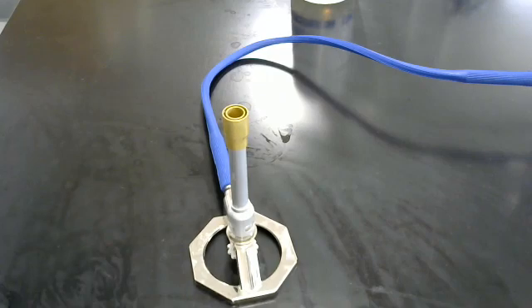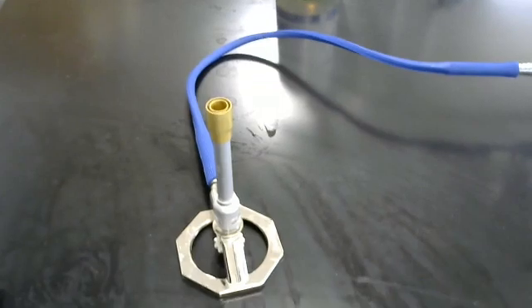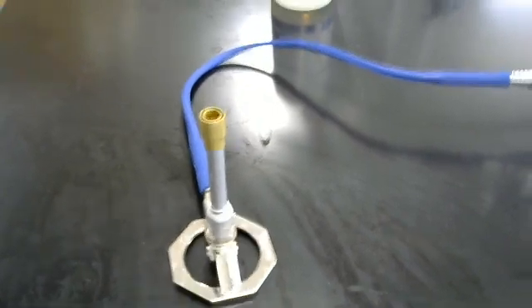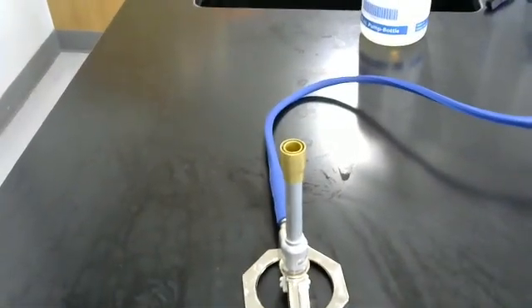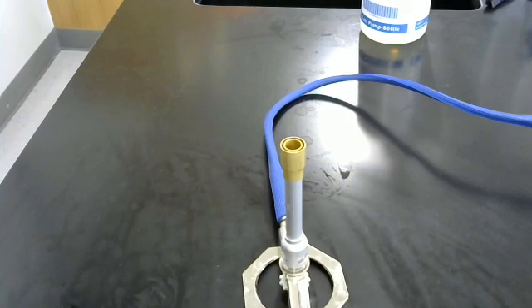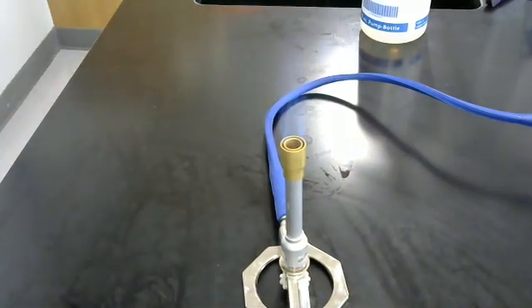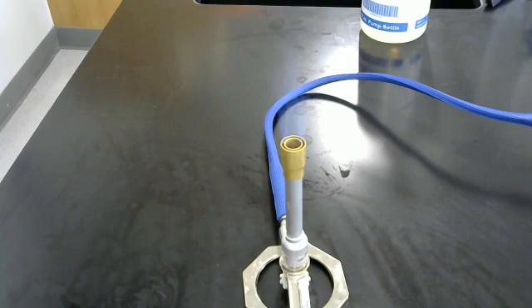Now, for tubes, we do something a little differently. For this, we are going to have, I'm going to adjust it a bit, some fire. You want to have some nice fire, nice growing fire going.